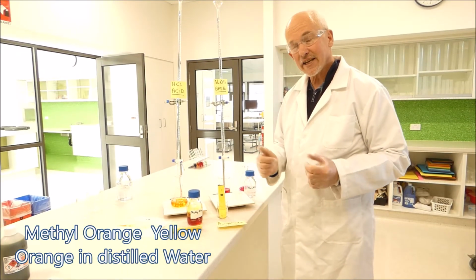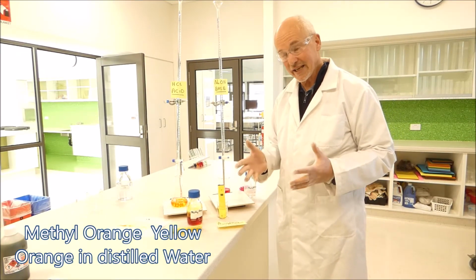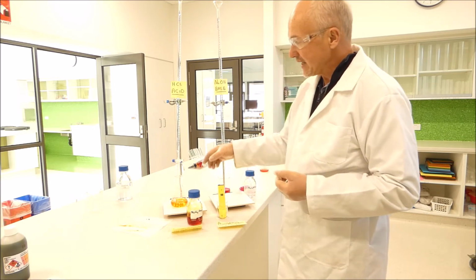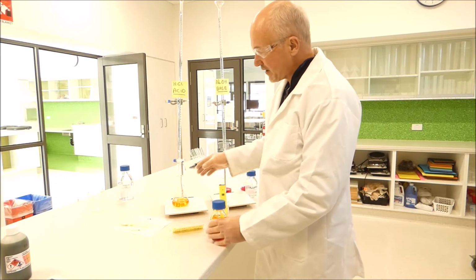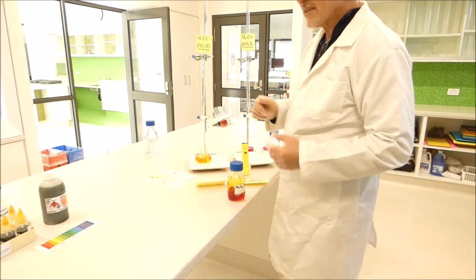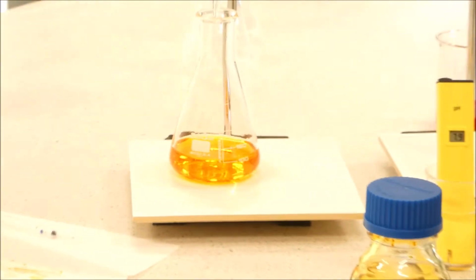Alright, so our second indicator, which is methyl orange, is an acid indicator. It changes at around 4.4 to 3.2 pH. It starts off in a bright orange colour at neutral, and as we add acid to it, it should change to a nice ruby red colour.